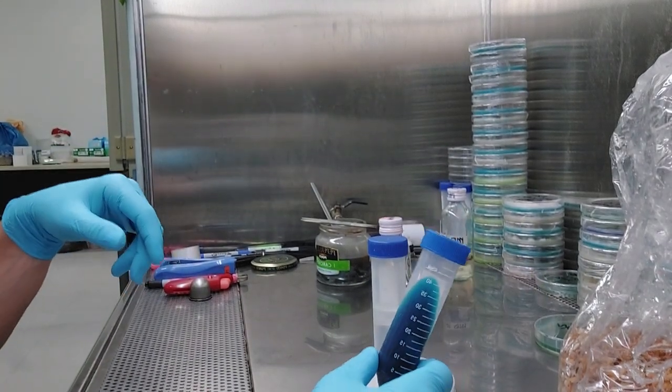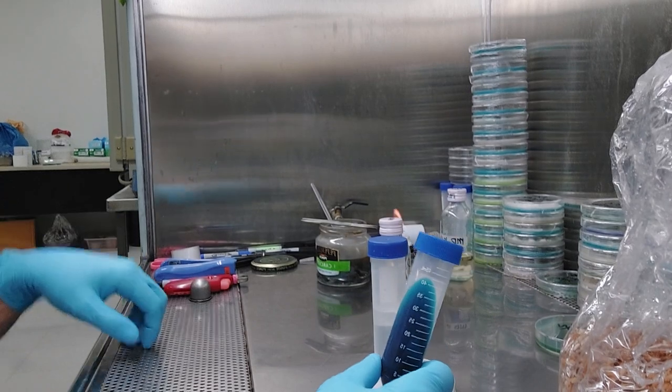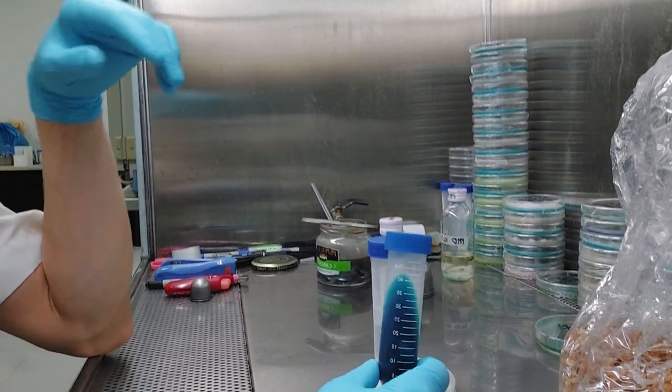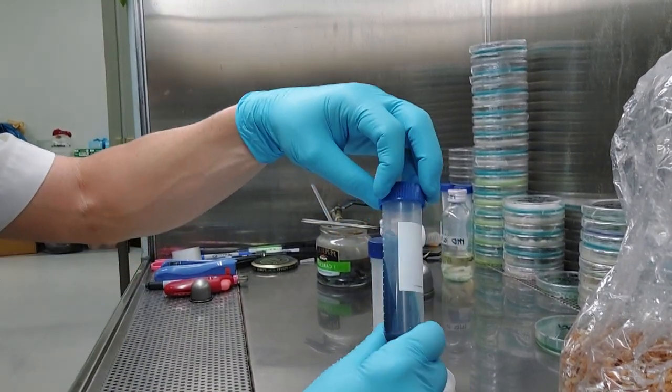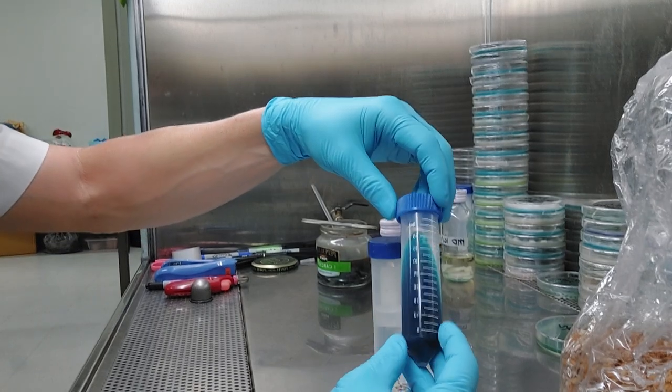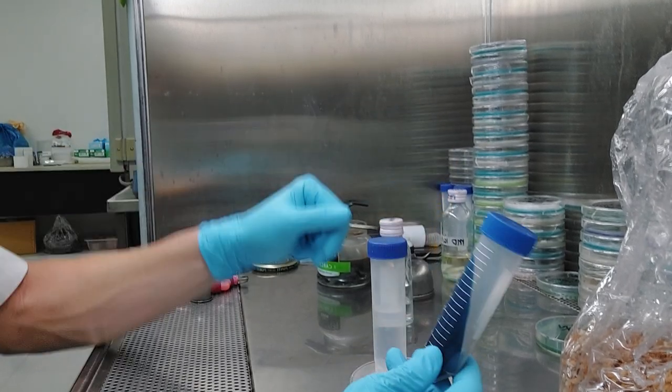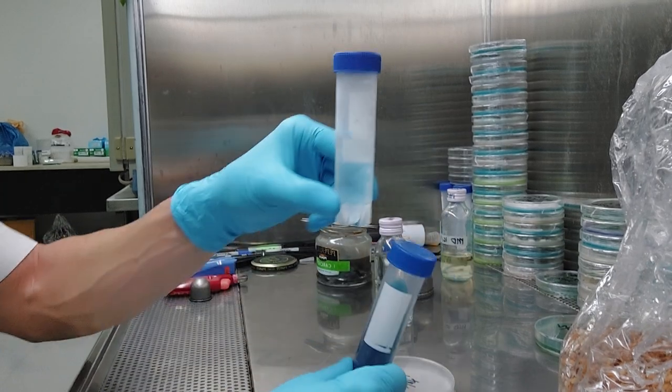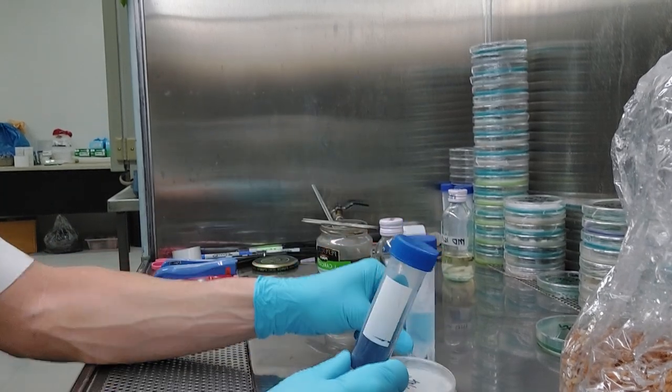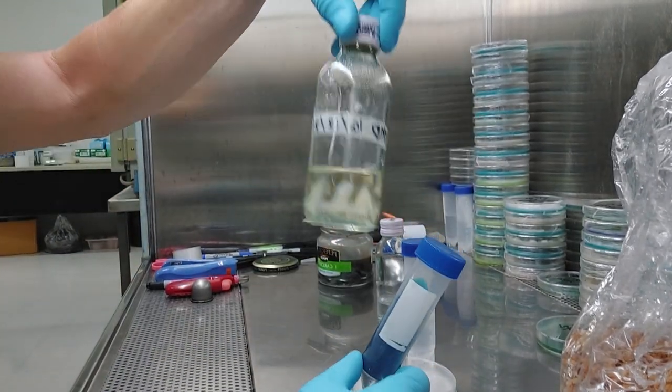They also sell 15 mL ones that I don't have floating around here, but they have, I think, now 5 and 10 mL. It just depends on what you want. But I like working with the 50 mL ones. They're nice and handy and they're not too big. So these are stand up water storage. Again, I pull this out. I pulled one out of this here.